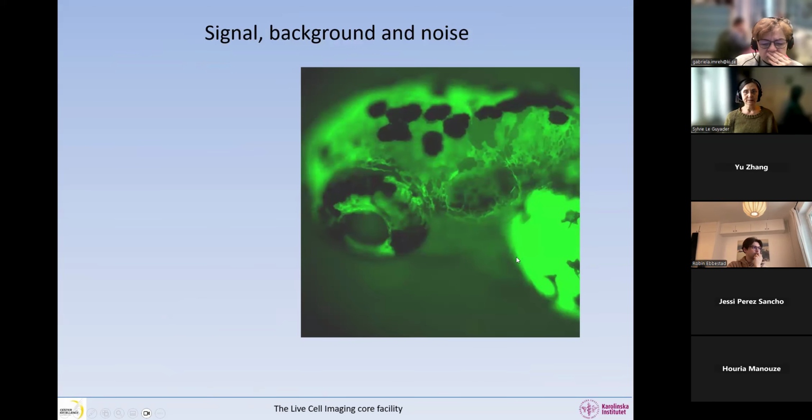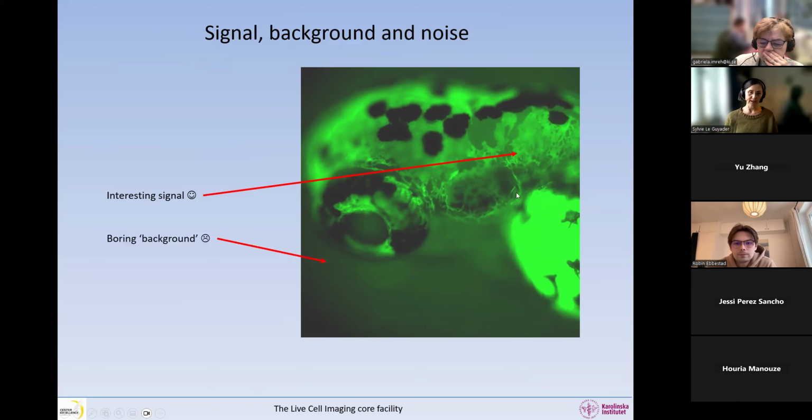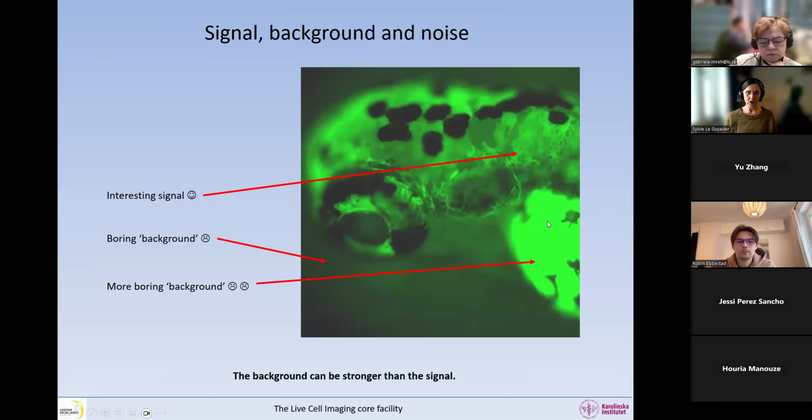Here is a nice zebrafish embryo. They are autofluorescent. So we get, oh, interesting, these cells are fluorescent. This is our signal. This is what we would like. Unfortunately, there's a lot of autofluorescence around, and we say, oh, that is a boring background. We also have this yolk that is superfluorescent. That is a very boring background. So you can see that the background can even be stronger than the signal in some cases. It's basically the background is fluorescence, but it's the stuff you do not want.